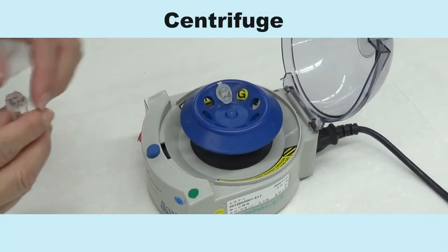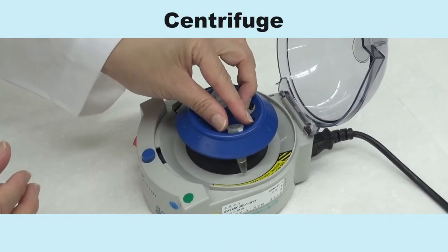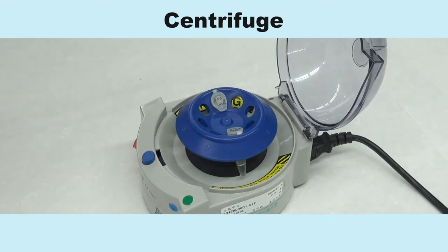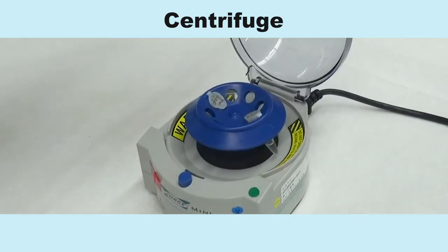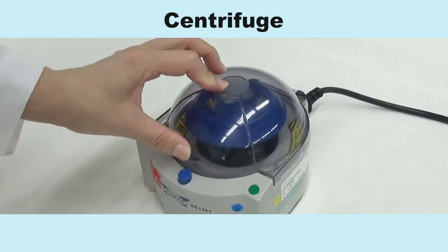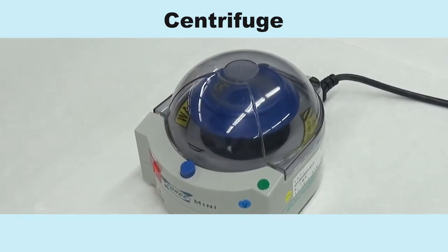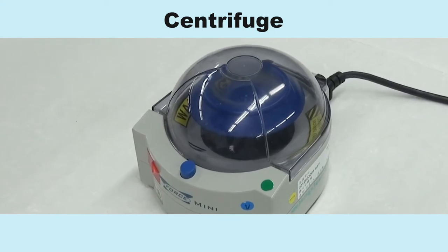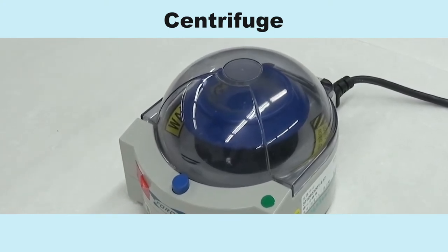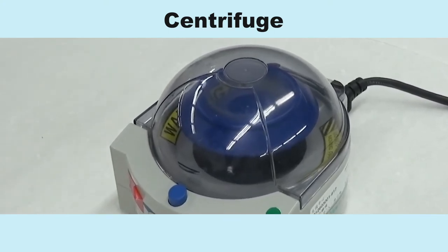A centrifuge is a device that creates a centrifugal force with high-speed rotation to allow for the different components within a solution to separate and precipitate according to their different sedimentation speeds.